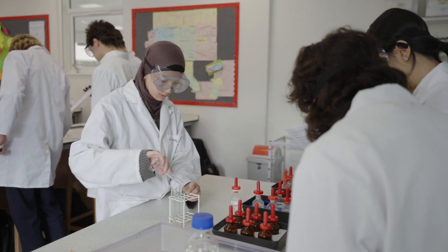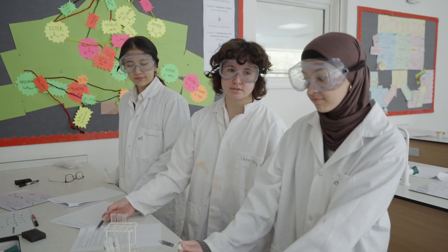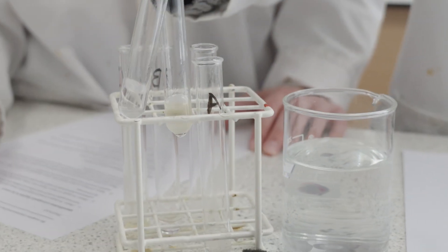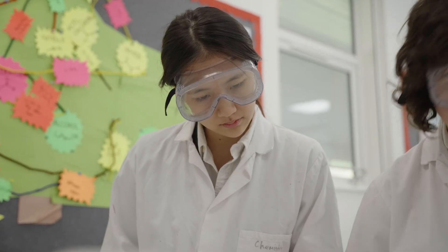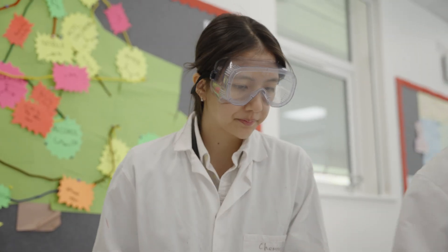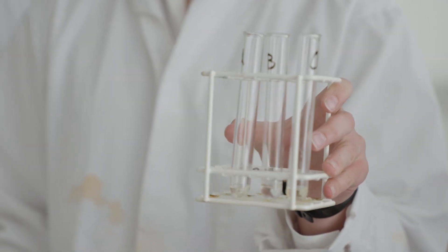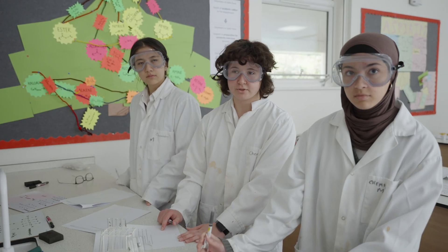We just did the test for bromine water, which basically tests if there's a double bond. We saw that it decolourised — went from yellow to colourless. That's the substance that has a double bond.